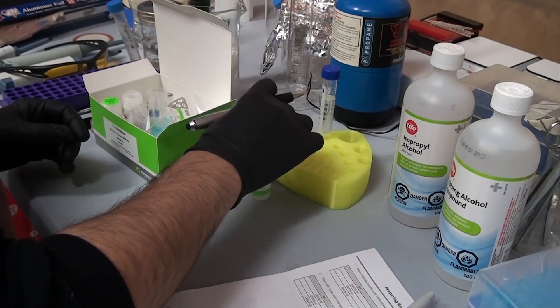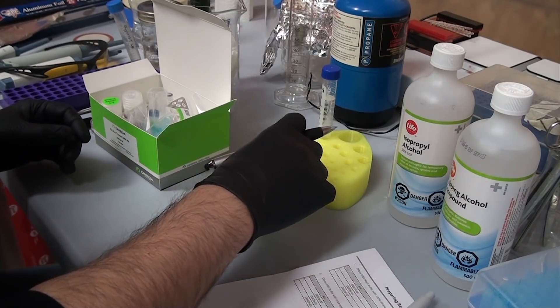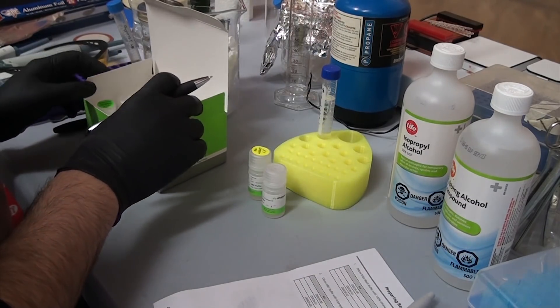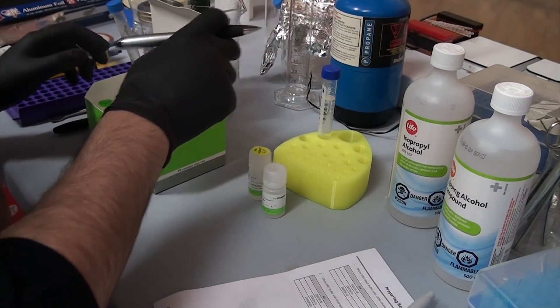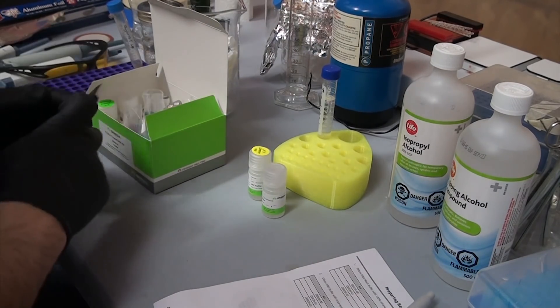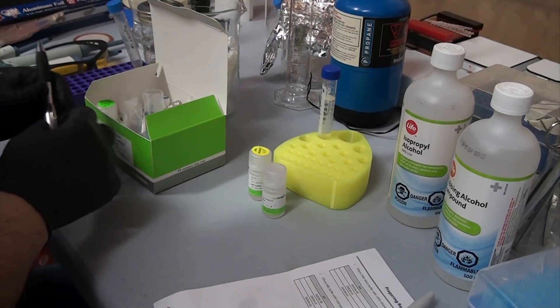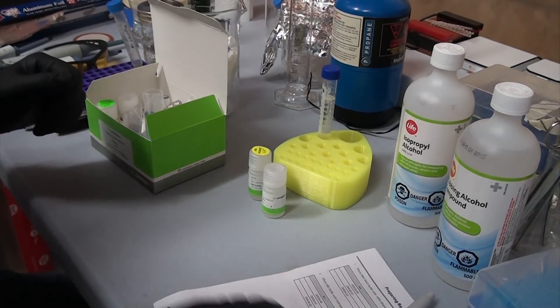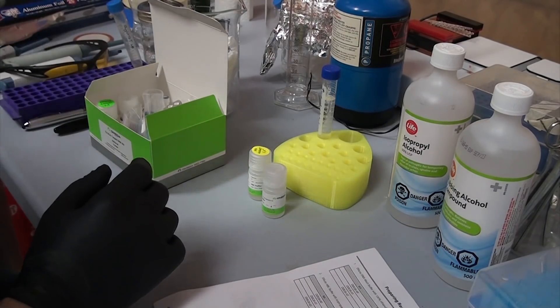So I picked up a special insect slash arthropod kit which addresses all of this. It's a 27 step procedure, and some of these steps loop or have long incubation times. When I did this, I started at 5pm and didn't finish until 11:30. Not time efficient by any means, but if it works, it works.